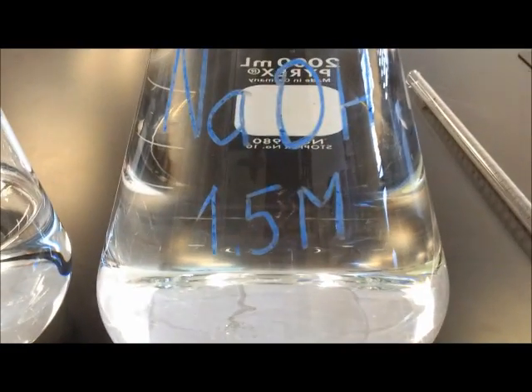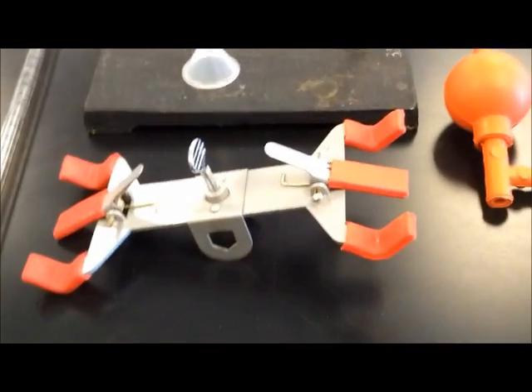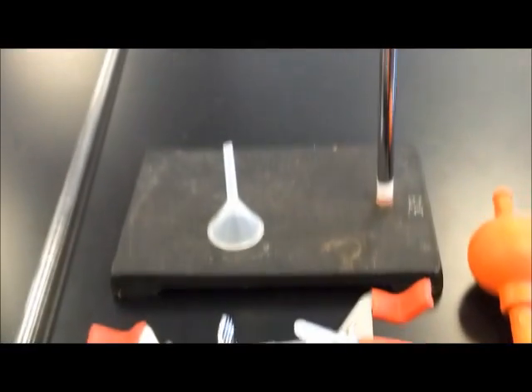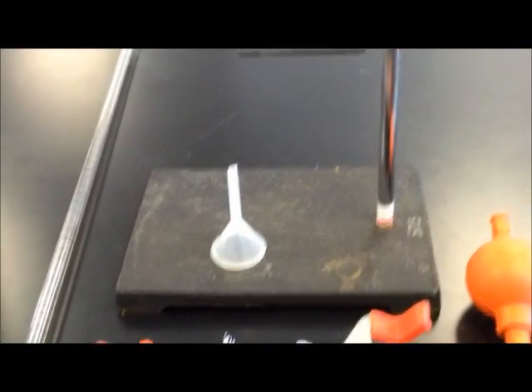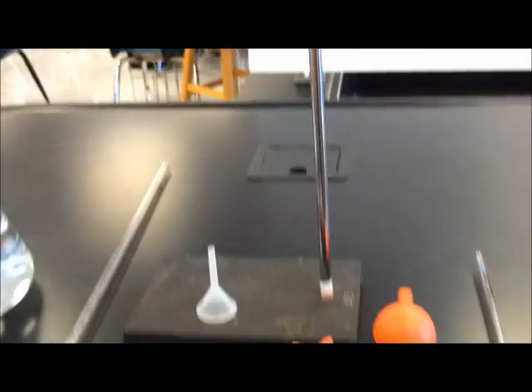We need a burette, a burette clamp, a funnel to fill up the burette, and a ring stand for the burette.